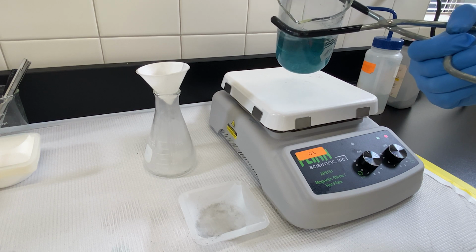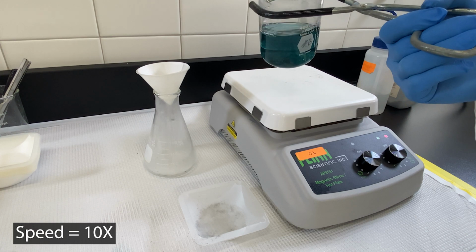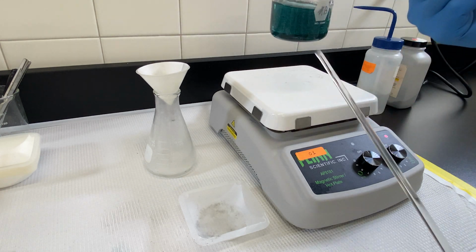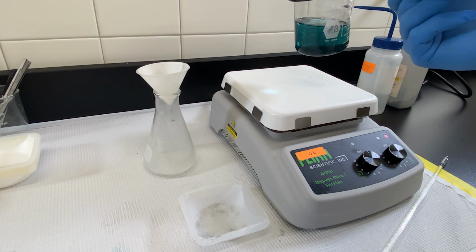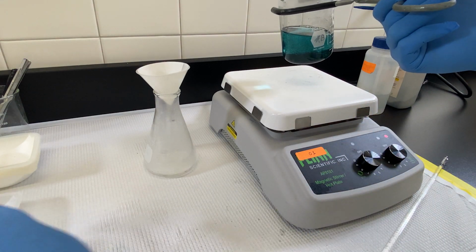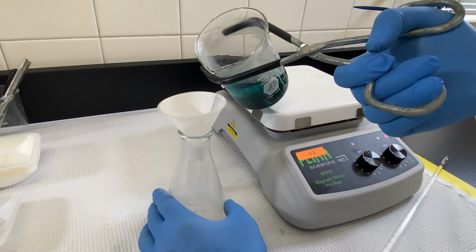Our mixture is now stirred into the hot water. Some of the material will be soluble in the hot water, and some of it will not. The material that's not can be filtered off, thus eliminating one of the 3 components in our mixture.